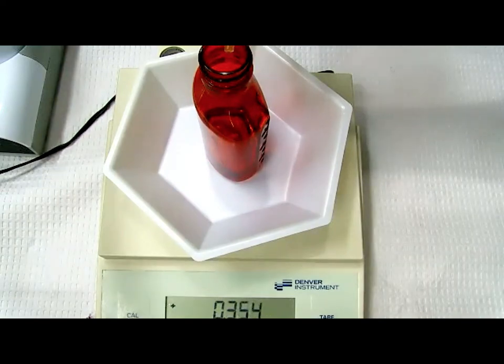As a reminder, it's certainly a way to do it, but as Judy emphasized again, if you go over, if you add too much, there's no undoing that. You have to start all over again. So no pressure on Dr. Wu here, but this is definitely a quick and easy way of doing it, but it does require precision to get our 1.4 grams as close as possible without going too far over.